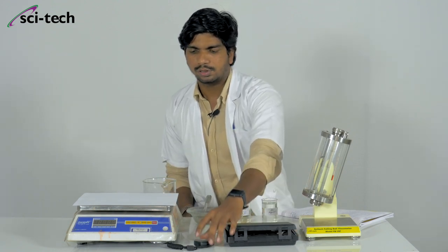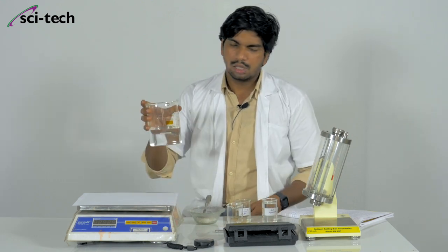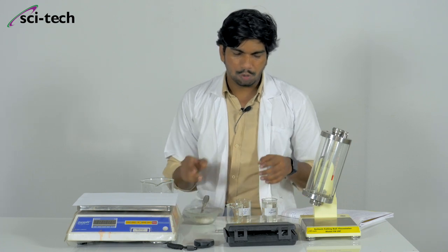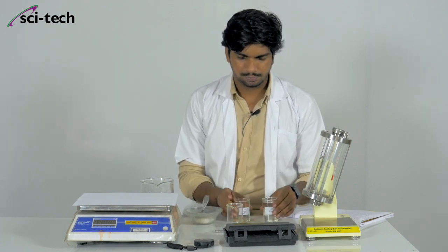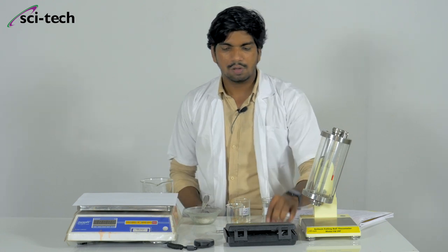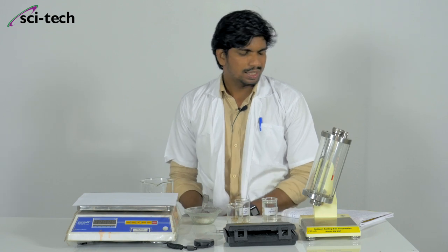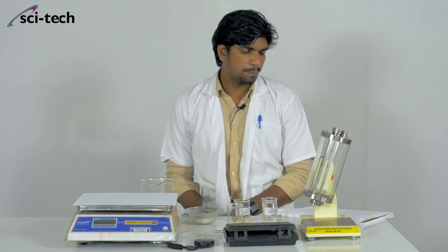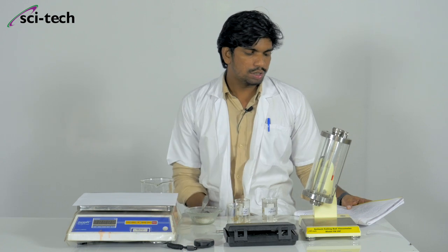We have a stopwatch, a weighing scale, beakers with water, sugar for making the sugar solution, and some samples. We will start with an introduction to the falling ball viscometer. It is based on the measuring principle of the Höppler principle and is very precise for measuring the dynamic viscosity of Newtonian fluids.